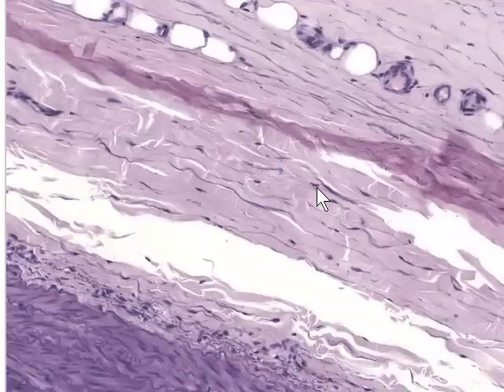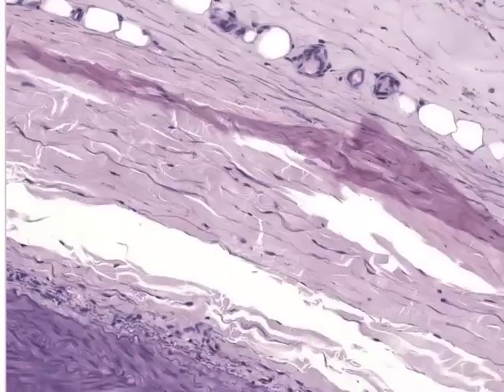The collagenous connective tissue on the aorta like this is quite dense. It's quite a thick connective tissue coat, and in fact in some senses almost resembles tendon, but tendon by definition is dense regular connective tissue, and only tendons are dense regular connective tissue. So we would refer to this as a dense irregular connective tissue external coat.